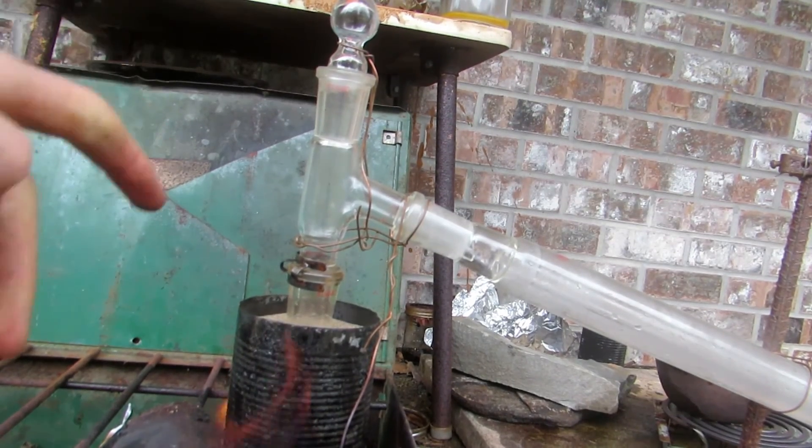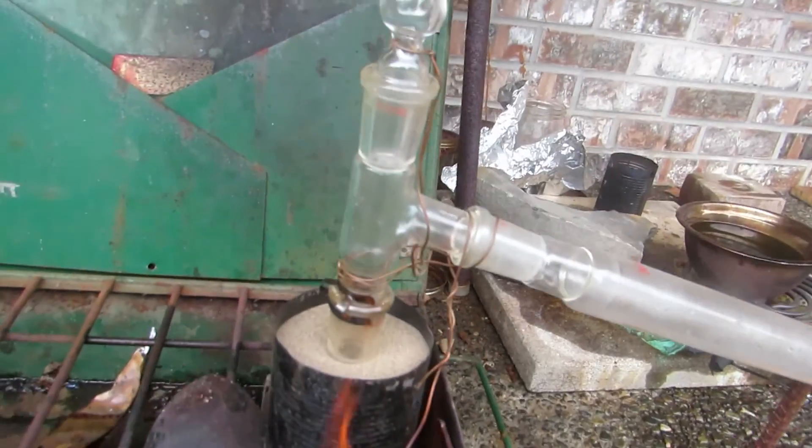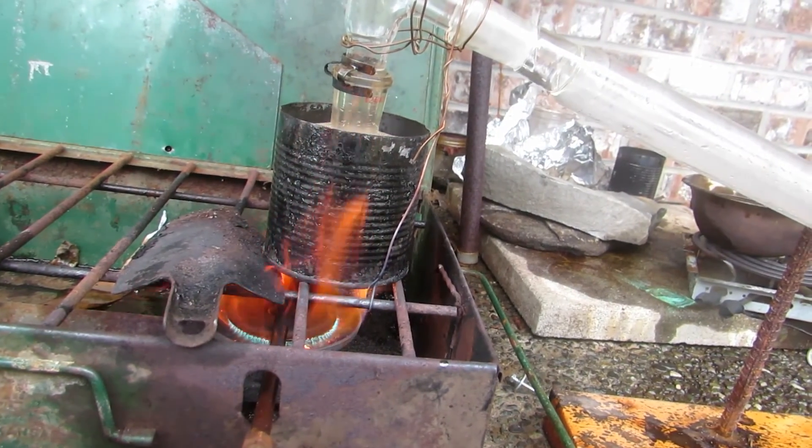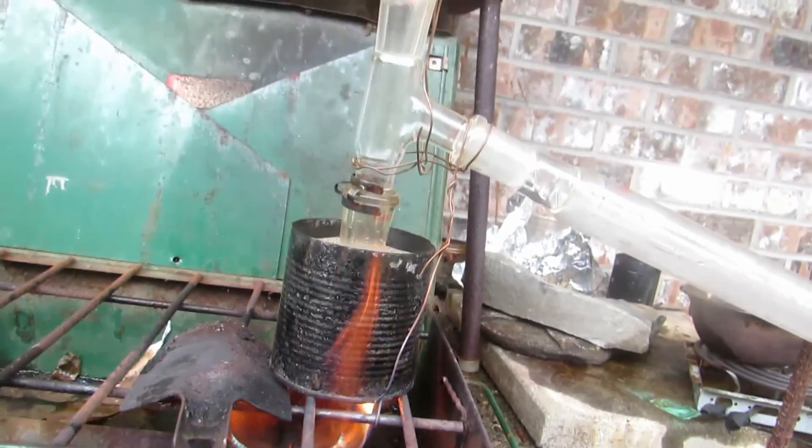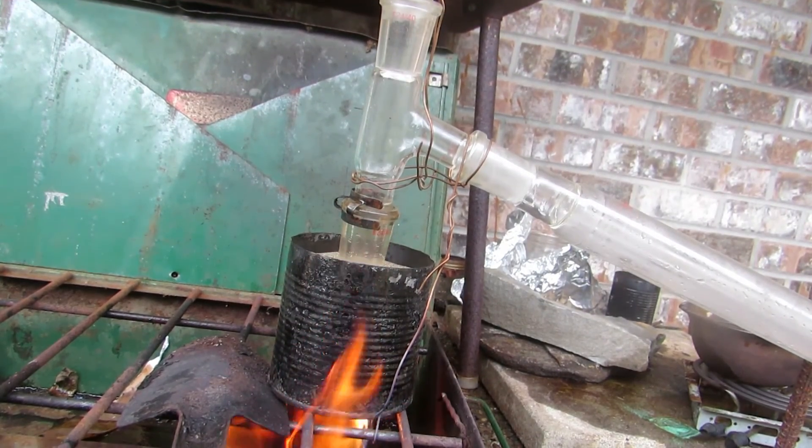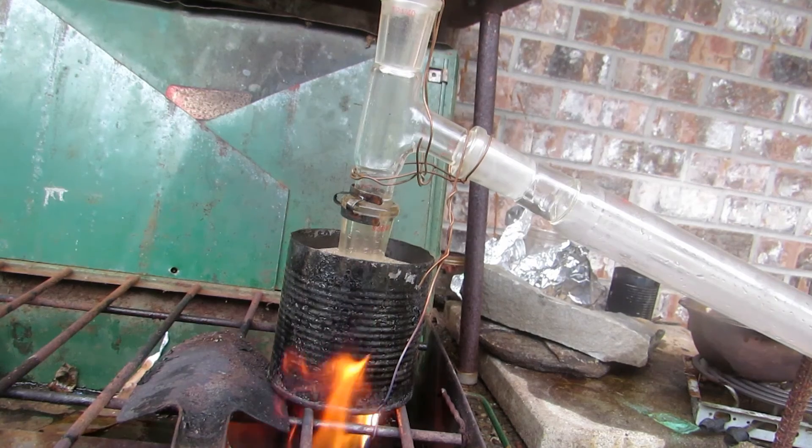There's a sand bath inside here on my camping stove getting nice and hot. The methyl salicylate will distill over and we'll collect it as our pure fraction.